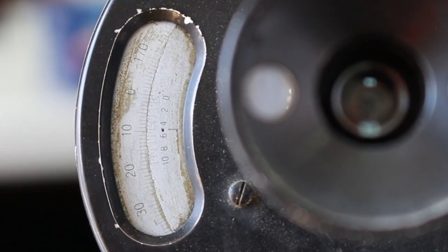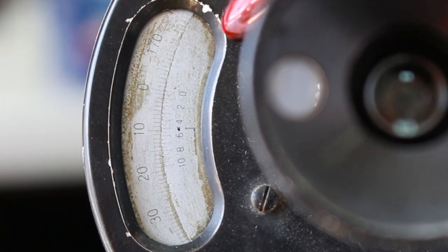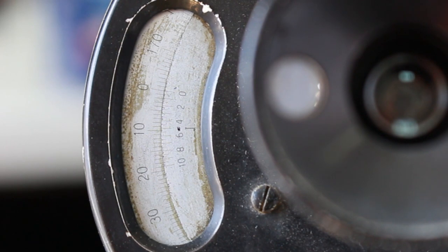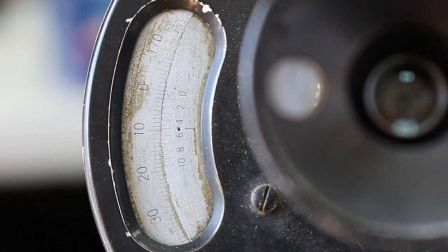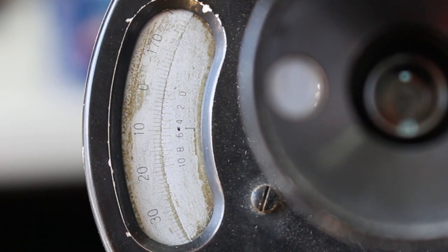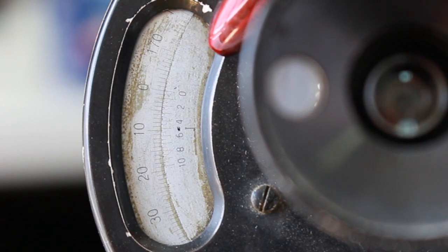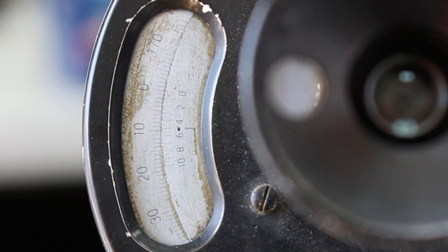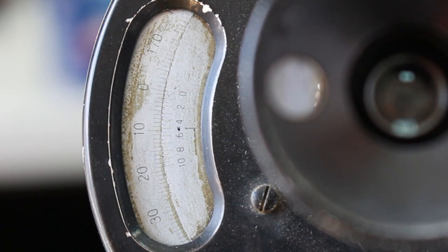Each scale has two parts: the inner part, which is a fixed part of the scale, and the outer part, which can be moved and changed by rotating the analyzer. If you take a look at the scale, the inner zero line perfectly aligns with the outer zero line, which means that the angle of rotation is zero in this case.